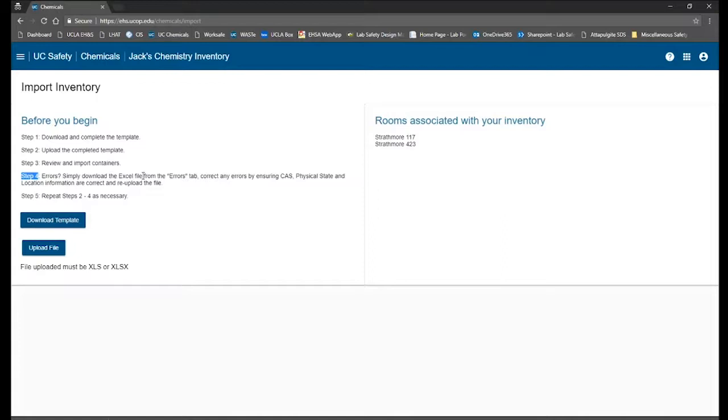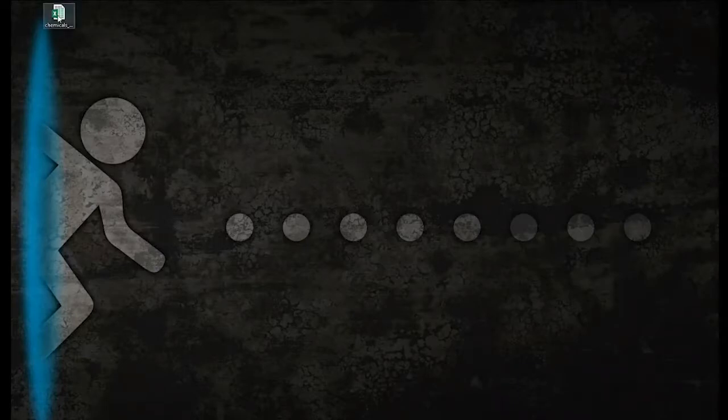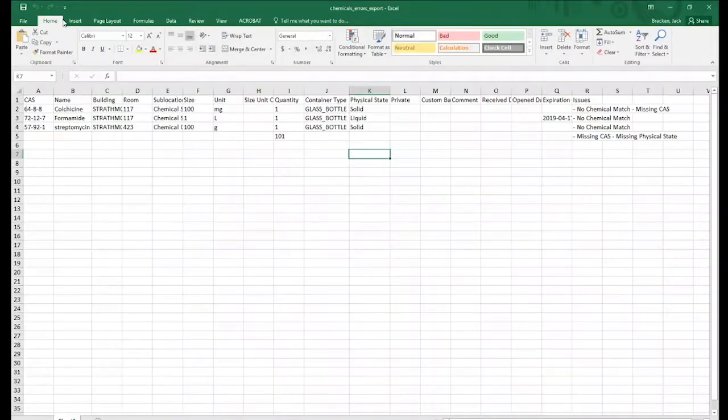So we automatically downloaded an Excel file last time with the errors, so let's go ahead and close the browser window, open that Excel file, and check out what we have. All the way to the right, you can see the issues column. For row number 2, the issues happen to be no chemical match and missing CAS number. In fact, for 3 of them, there's no chemical match. Other errors you might see here might be incorrect units, issues with container type, or physical state.